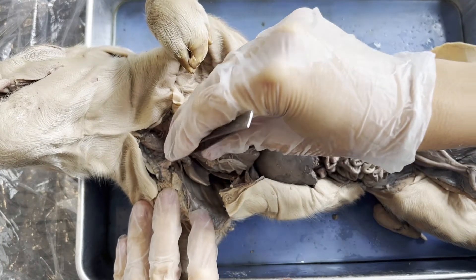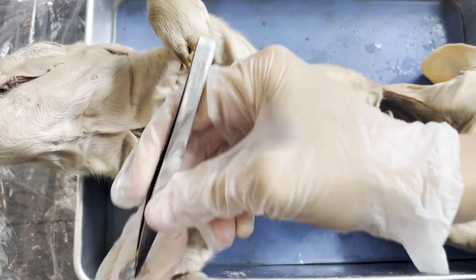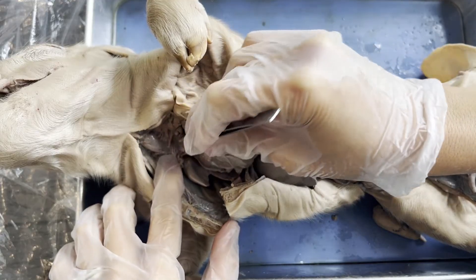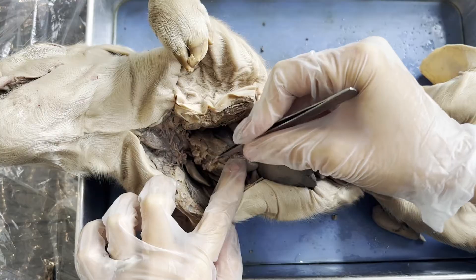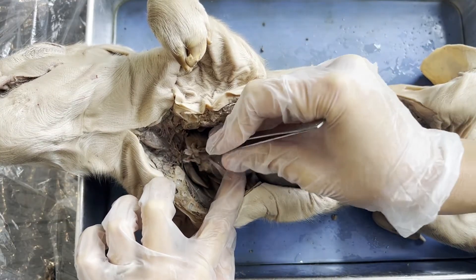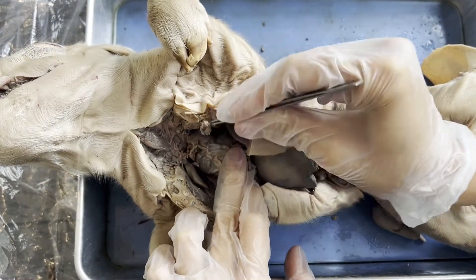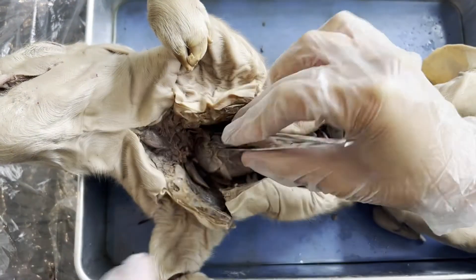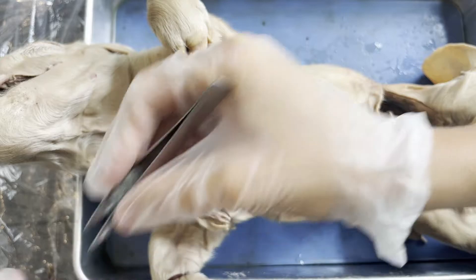At this point, we're going to remove the thymus gland and the thyroid gland. So I am just going to carefully, without damaging the heart and without damaging the lungs, try and pull portions of the thymus gland out. There we go — no more thymus.